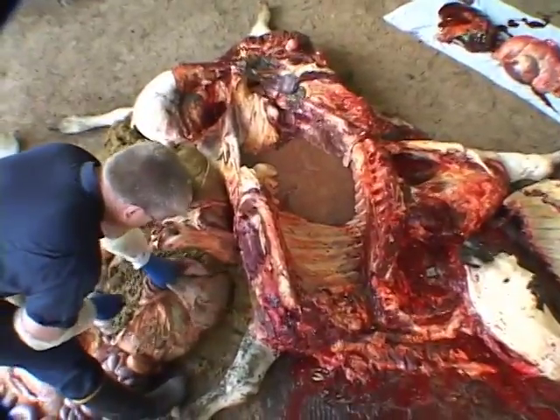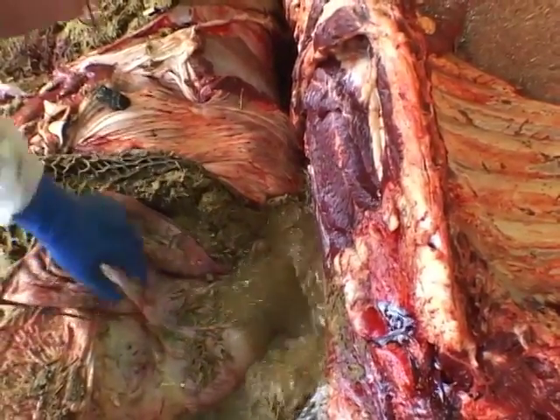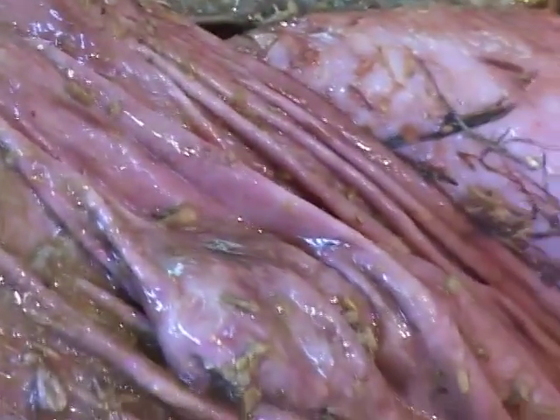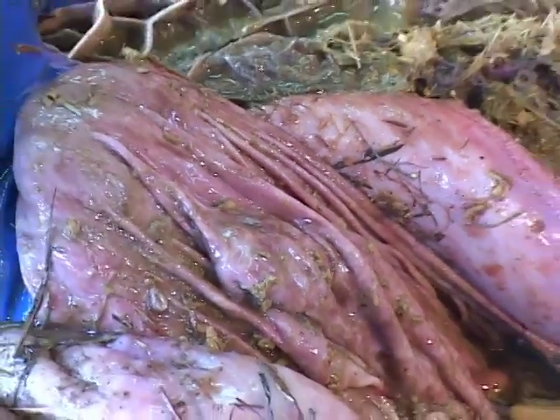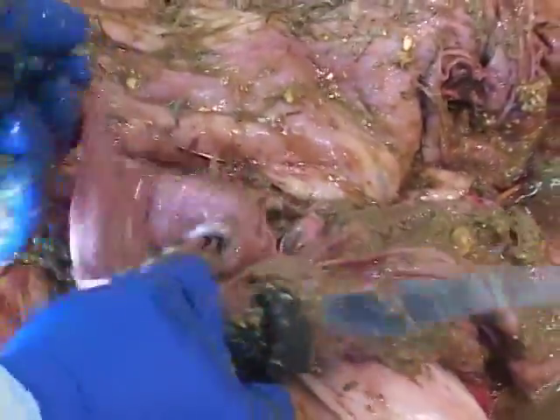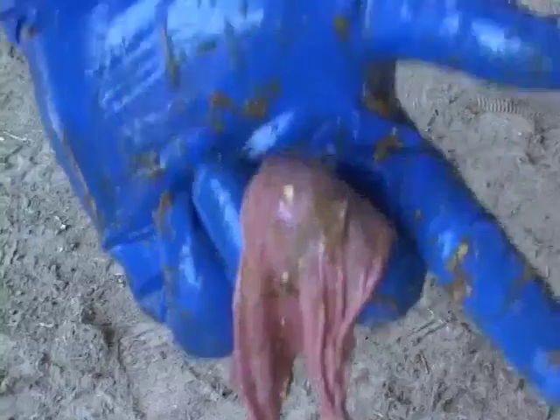Open the abomasum and empty the contents. This is a common site of disease. Inspect the mucosal surface carefully for evidence of erosions, ulceration, hemorrhage, and neoplasia, as the abomasum is a common site for lymphosarcoma. Collect a tissue sample for histology.